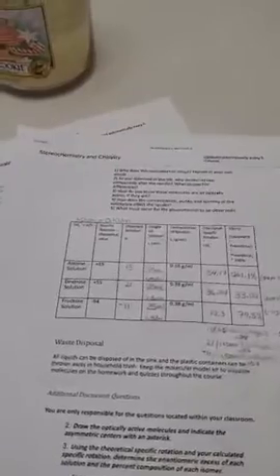I found my calculated specific rotation down here. I did each line. My dextrose came out to 36.84, and my fructose came out to negative 19.3. I turned the page over and did all of my math in the back. I calculated my optical purity, the racemic, as well as the plus and negative isomer in each amount.